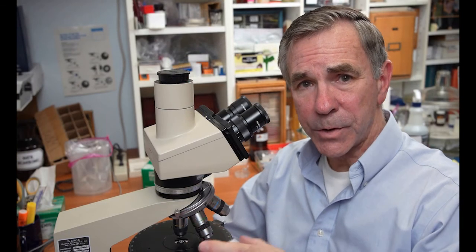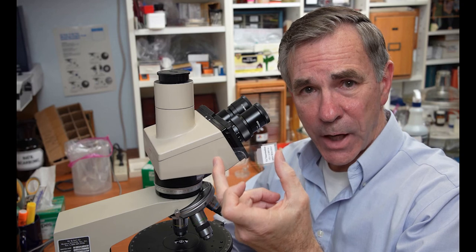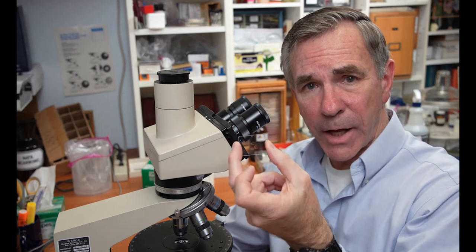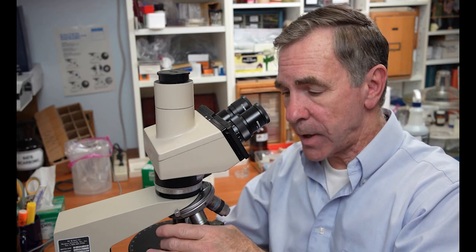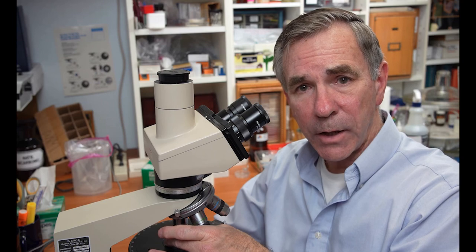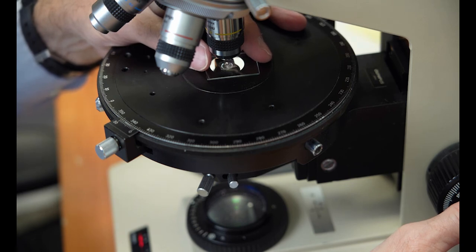Not always do we use a 1 by 3 inch slide or a 75 millimeter by 25 millimeter slide. Sometimes we use half slides. And even with the half slide, you still use your thumb and middle finger to control the slide on the stage. The same applies with the hand. It wraps around the stage, and you use your thumb and middle finger to control the slide, as you'll see now. Here you can see with the thumb and the middle finger, you have good control on the slide and can move it very small distances on the stage.